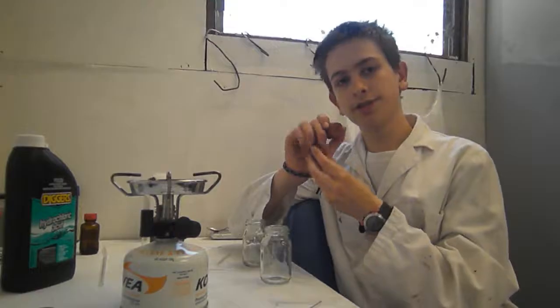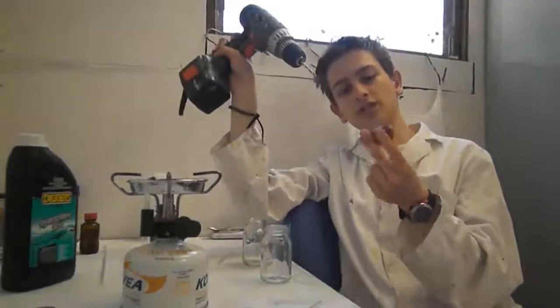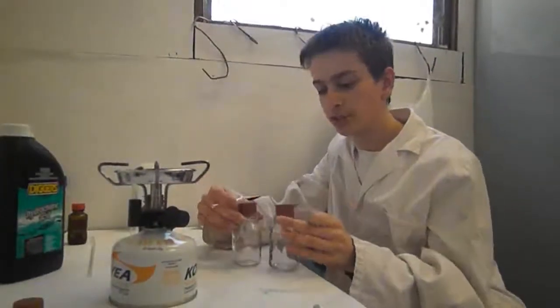I've got these two stoppers. What I'm going to be doing with those is drilling a couple of holes in each of them. So these are my little bottles here. In this bottle, I'll have some hydrochloric acid.